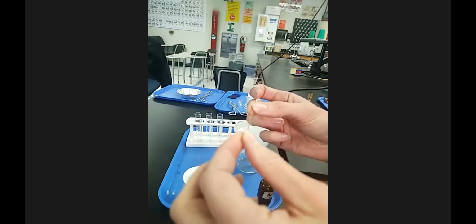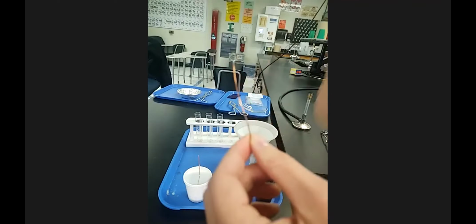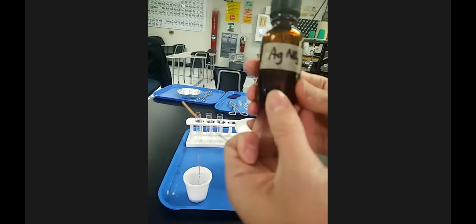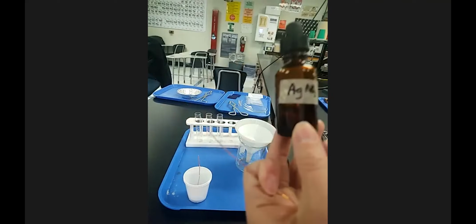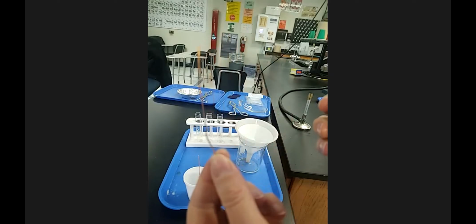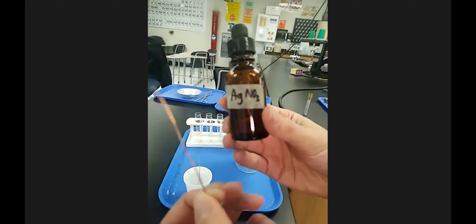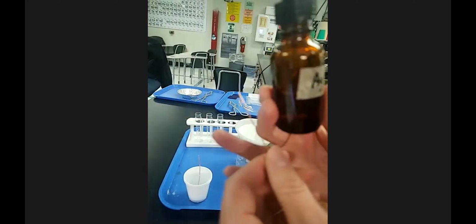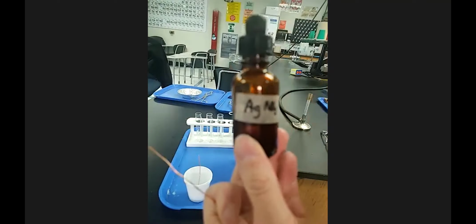Okay, so for the lab, on the predicting products worksheet, it'll say in words something like solid copper is added with silver nitrate solution, okay? And then you have to predict the products. You're going to use your observations. This one's pretty obvious. Here's a piece of solid copper to determine states of matter, and then silver nitrate solution. You're going to then have to write the state of matter based on what it is.